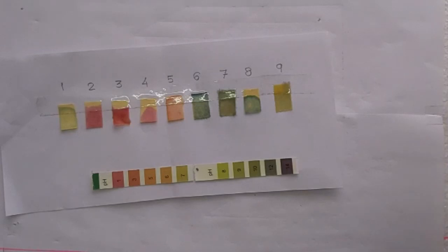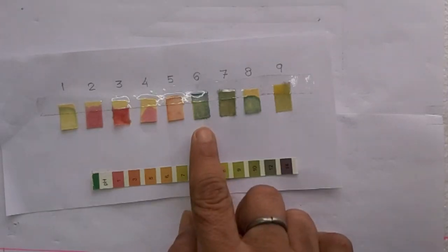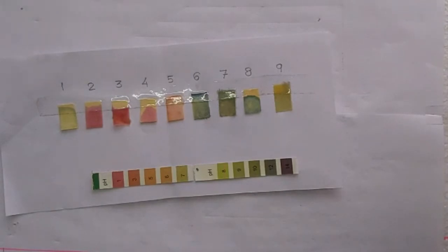And then at number 6 we have sodium hydroxide, and its color shows that it is very strong. And then again we have base magnesium hydroxide. Actually, magnesium hydroxide, I made it by burning magnesium ribbon and then dissolving those ashes into water, and it shows it is strong. And then another one, eighth number is potassium hydroxide KOH. It is also a strong base. And then at ninth place we have calcium hydroxide, not so strong.